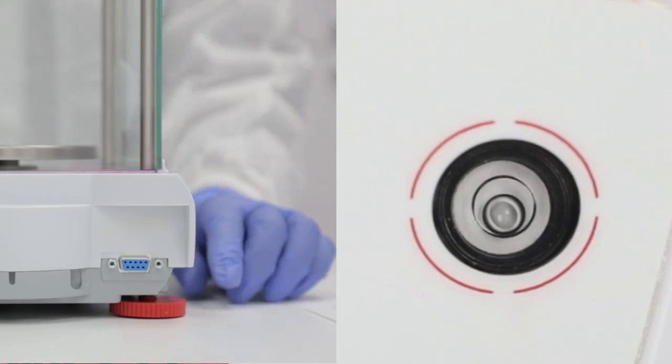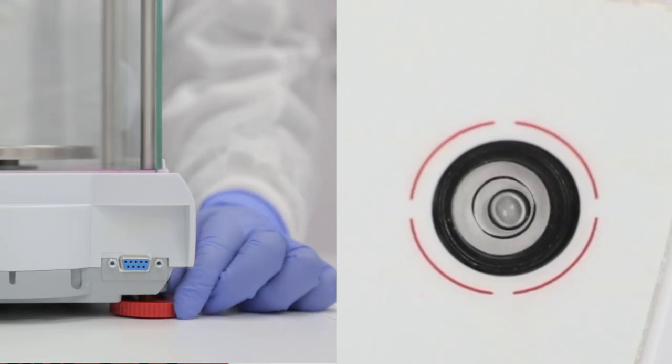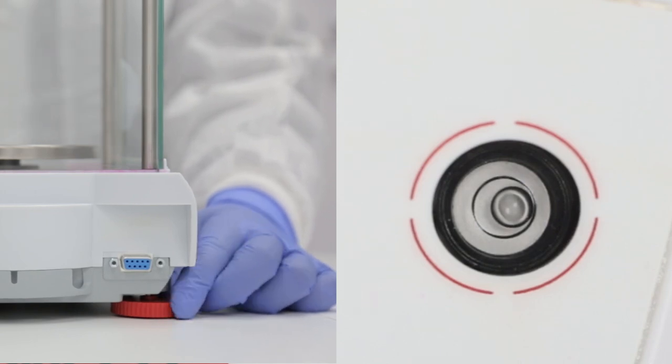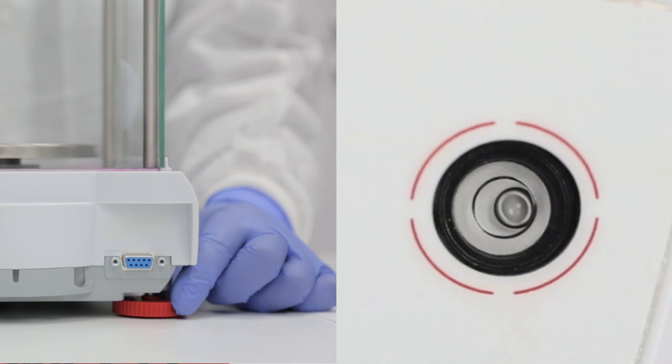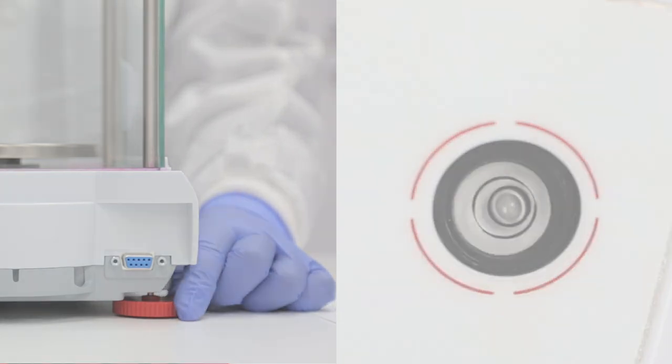Using these simple guidelines, you can play around and adjust the feet of your electronic balance to ensure it is level according to the level indicator. After you have leveled the balance, it's time to move on to the calibration.